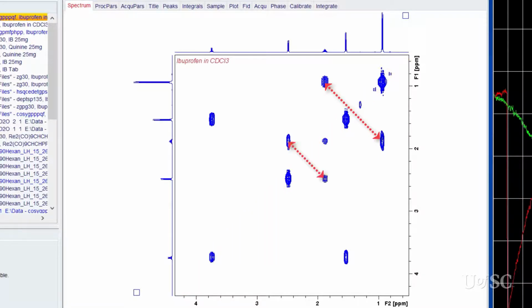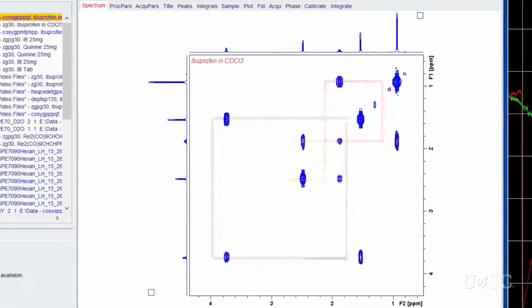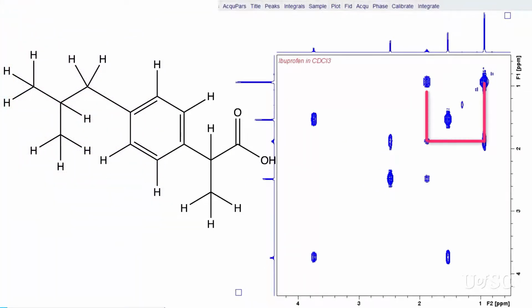These cross peaks form at symmetric points from the diagonal. They connect two resonances on the diagonal, with a pattern of a square. In the case of the furthest upfield resonance, the isopropyl methyl protons show a connection to the methine resonance. The methine is also coupled to the methylene protons, and this coupling is shown with the second correlation.